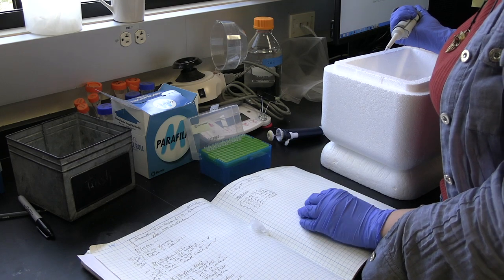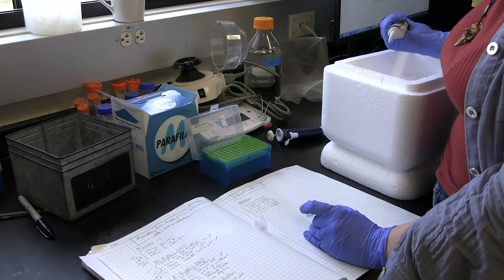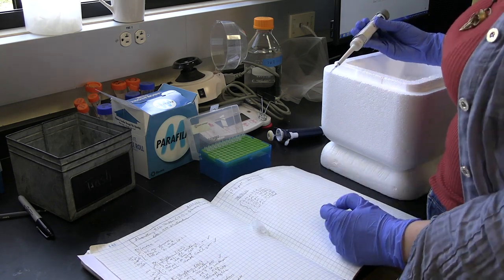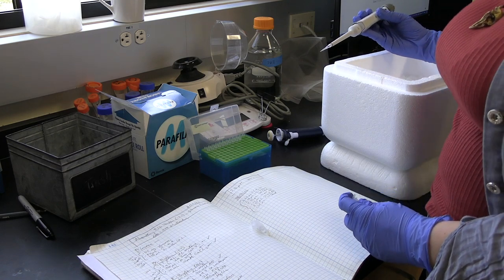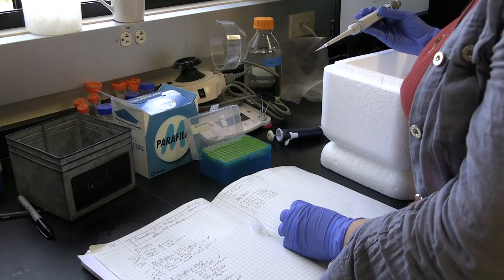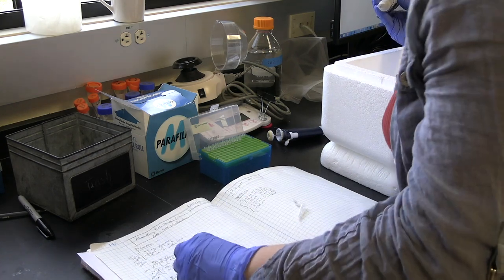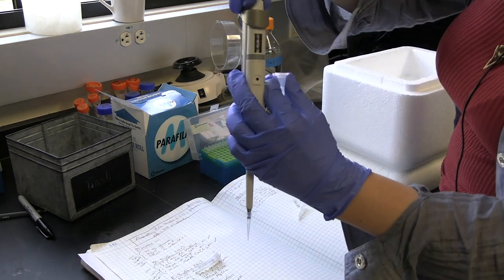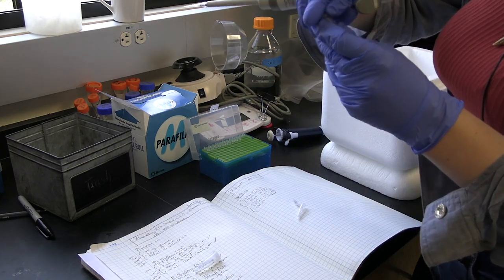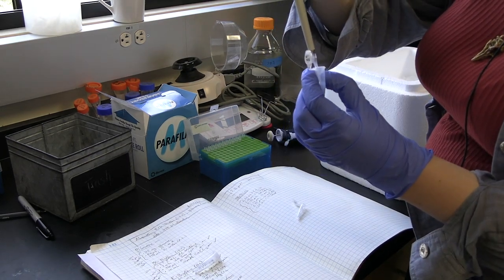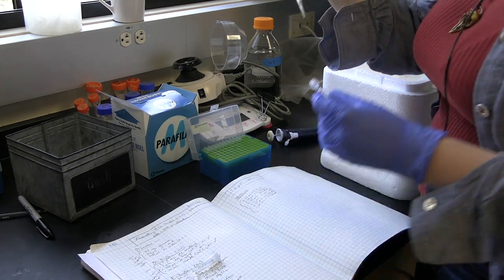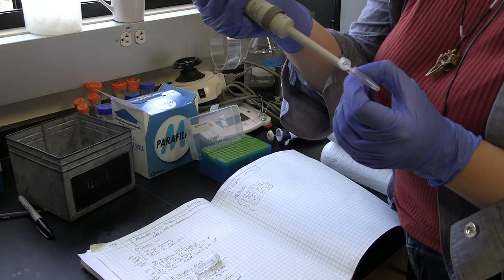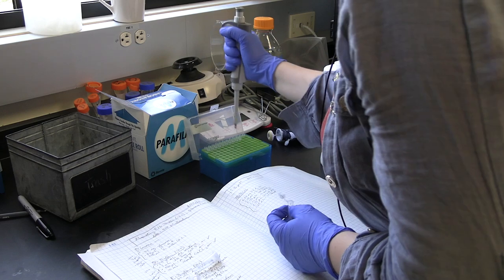We're going to make a microtubule network. Essentially, we're going to add fluorescently labeled microtubule dimers to a sample with buffer and polymerization agents, let it incubate for 30 minutes, then put it under a microscope. First thing we always add is our buffer. It's always important to add the buffer first, so we add 6.6 microliters of PEM buffer to a tube which you've labeled with microtubule network or something descriptive.